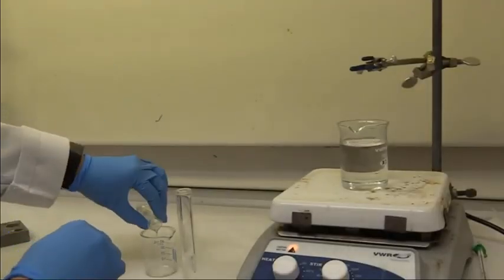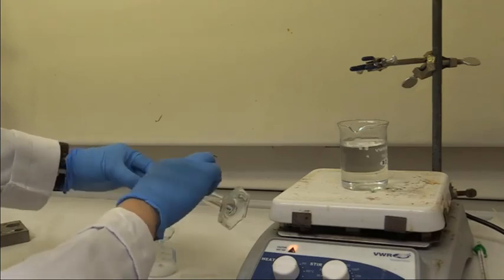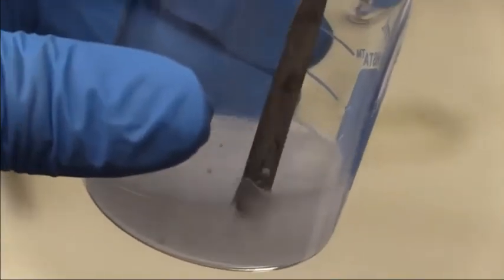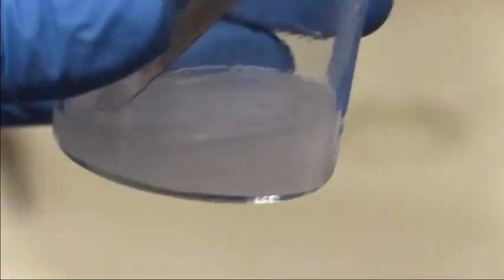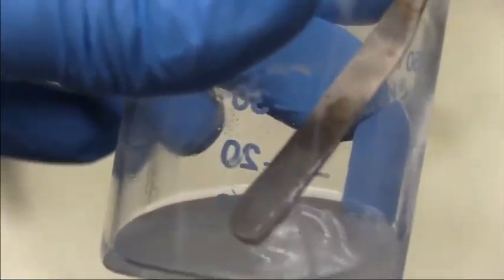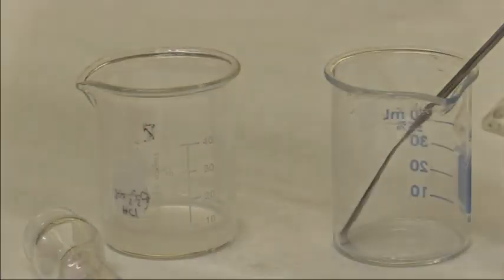Transfer the mixture to a small beaker, using 5 ml of methanol for the transfer. Use a flat-bladed microspatula to stir the polystyrene while pressing the gummy solid against the sides of the beaker to squeeze out absorbed toluene. Pipette off the liquid and add fresh methanol, repeating the process a few times until the solid is hardened and no longer sticky.